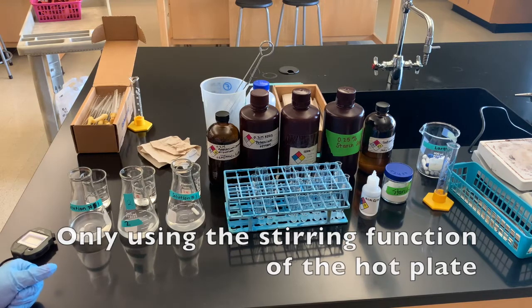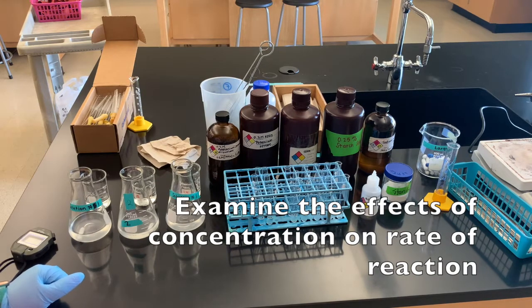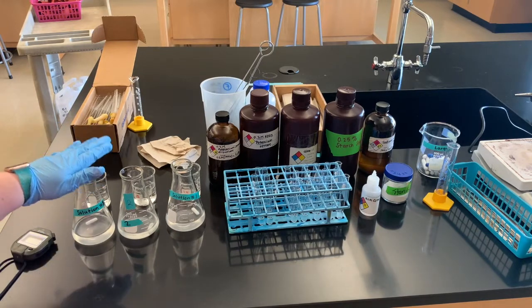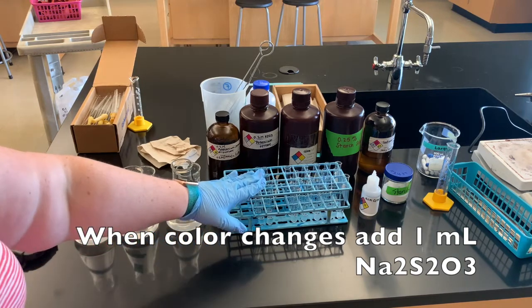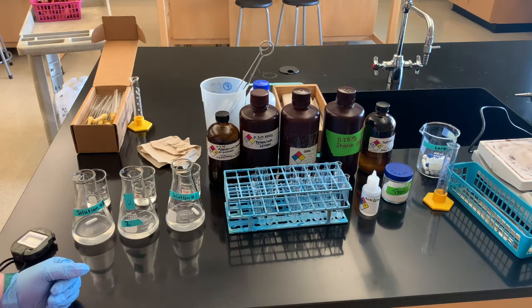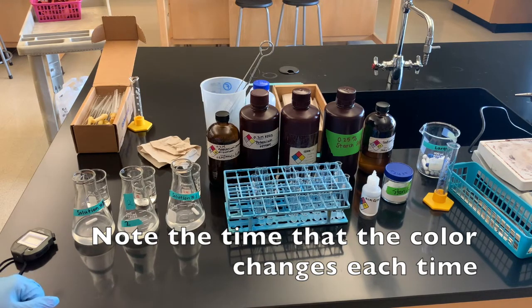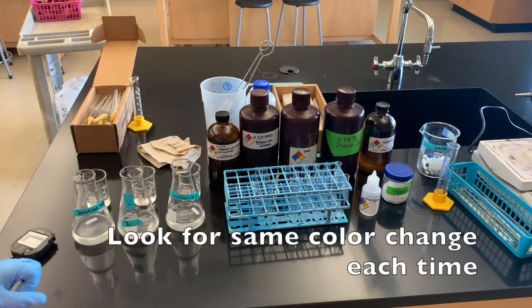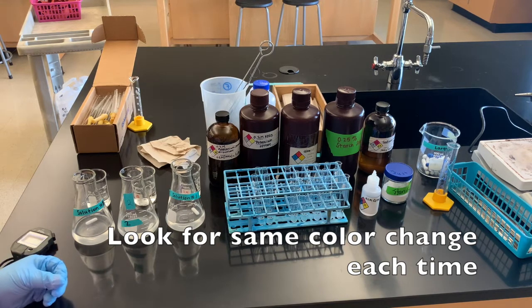Remember that you are only looking at the effects of concentration on the rates of reaction in this lab. I'm going to start my timer when I dump this beaker into this flask, and then when I see the color change I'll add in one test tube. We'll see the color go back, then wait for another color change and add the next test tube. Note the cumulative time each time you add another aliquot, and make sure you're looking for the same color change each time before adding your aliquot.